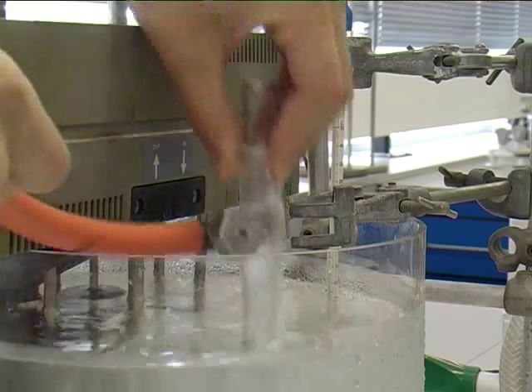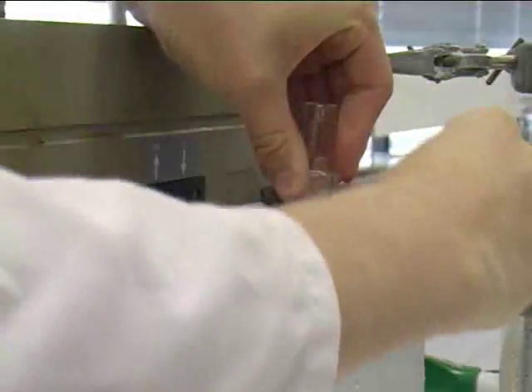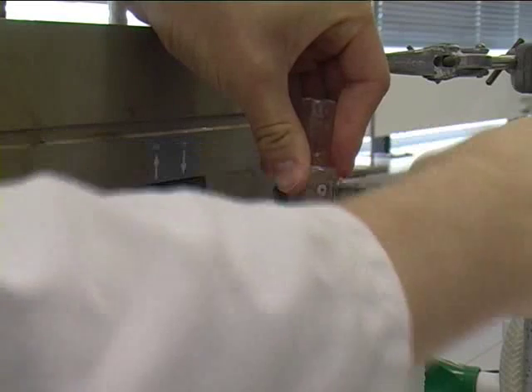The boiling tube must be clamped in the water bath. The water bath must be below 15 degrees Celsius when the apparatus is set up.